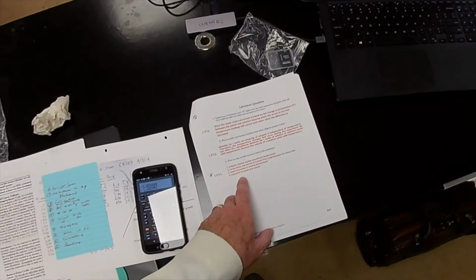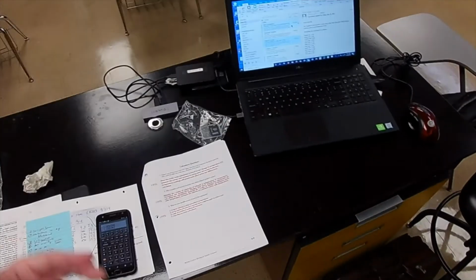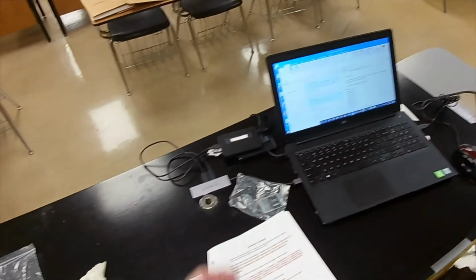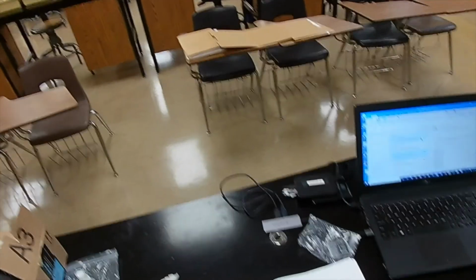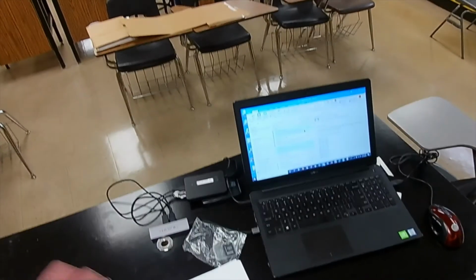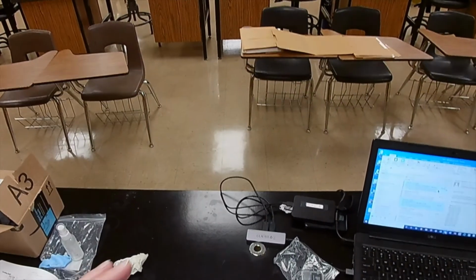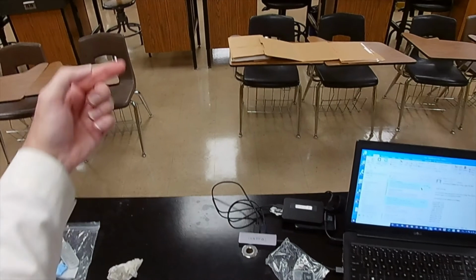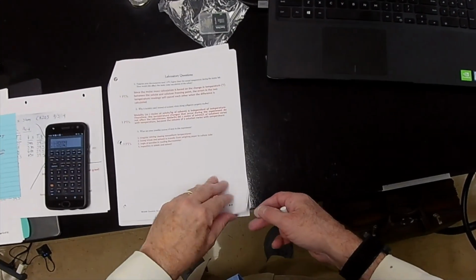What are some possible sources of error in the experiment? Okay, just think about it. Go back and think about what we did. Where could you have error? I mentioned one of them, but that's not the only one. You know, there could be errors with the equipment, some types of errors. There could be errors that are introduced by the experimenter. I could have made errors. And if you were observing, you may have seen some possible errors. Never discount the possibility of errors that occur from reading instruments. Okay, that's all I'm going to say about that.